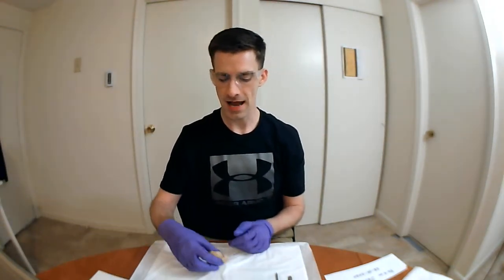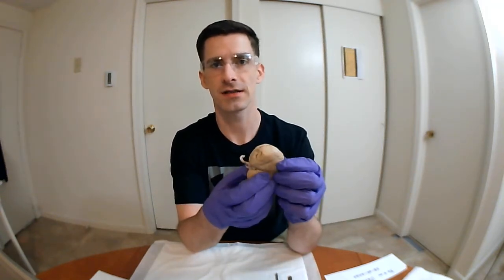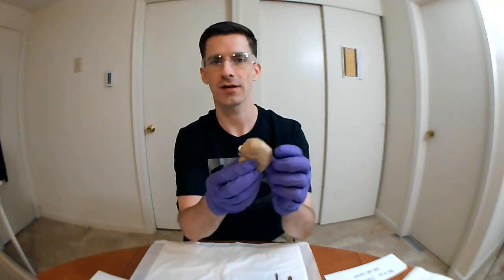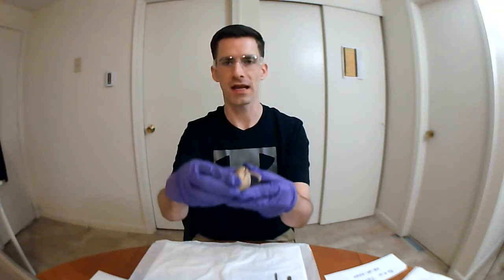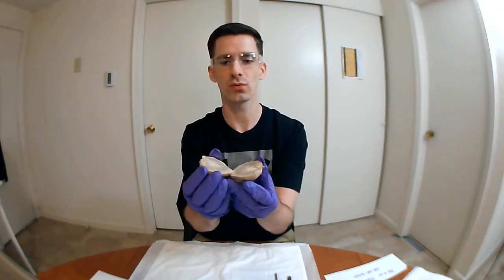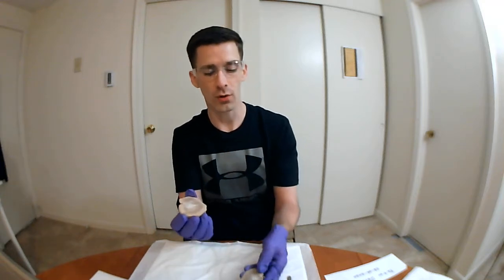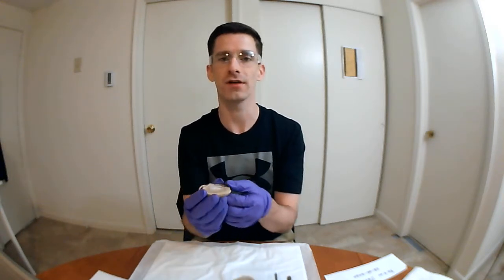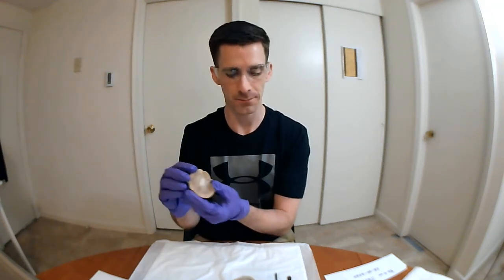And here I have an intact whole sheep kidney specimen that has already been dissected by introducing a longitudinal cut at the midpoint, so I've been able to separate it into two coronal cross-sections, or two coronal halves. So in order to label some of the relevant anatomical features, I'm going to examine this half here.